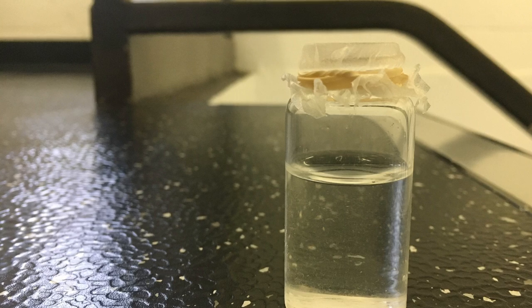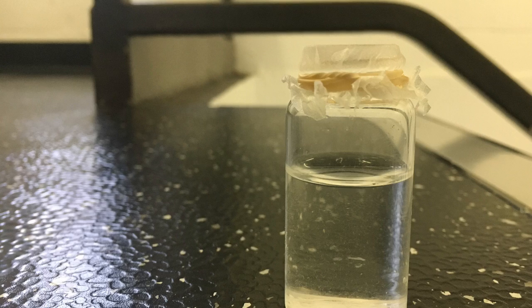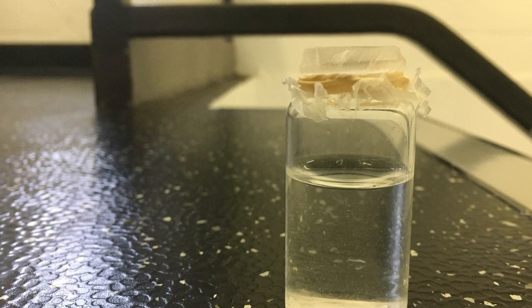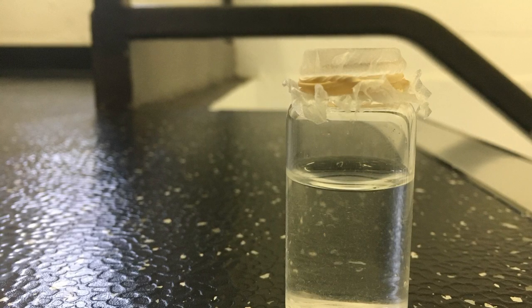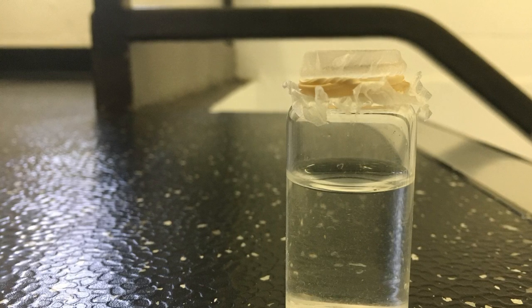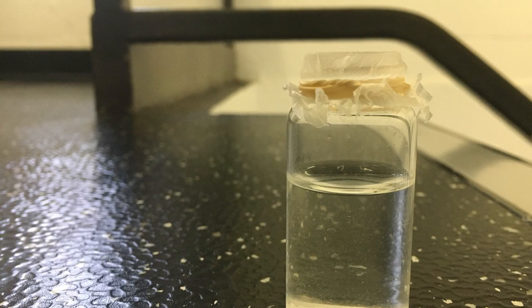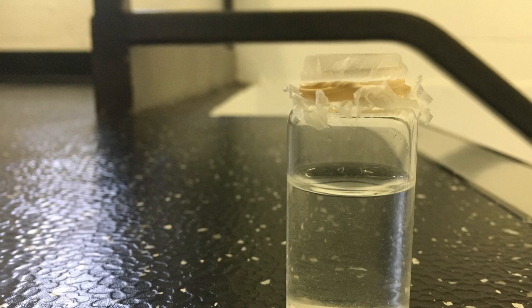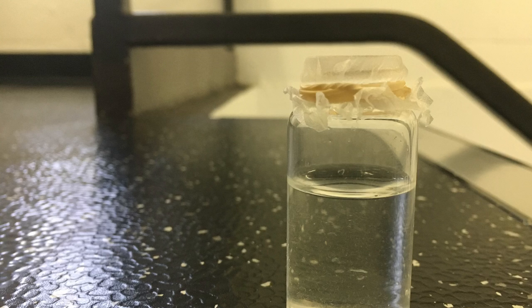Then the solution must be heated in order to supersaturate it. Allow this solution to cool back down to room temperature, and then filter out any remaining solid by gravity filtration in a 5.5 centimeter filter paper directly into one vial. After this step has been completed, it must be capped with a Kimwipe and a rubber band in order to ensure that the solution slowly evaporates, and does not do so too quickly or does not evaporate at all. This is important because without this slow evaporation, crystals would not be able to form at the bottom of your vial.